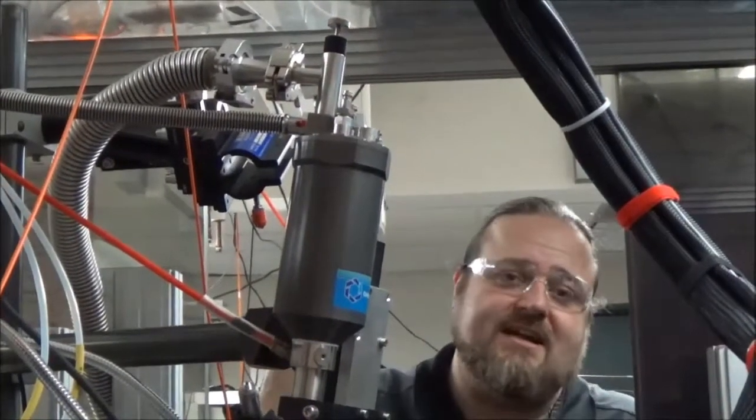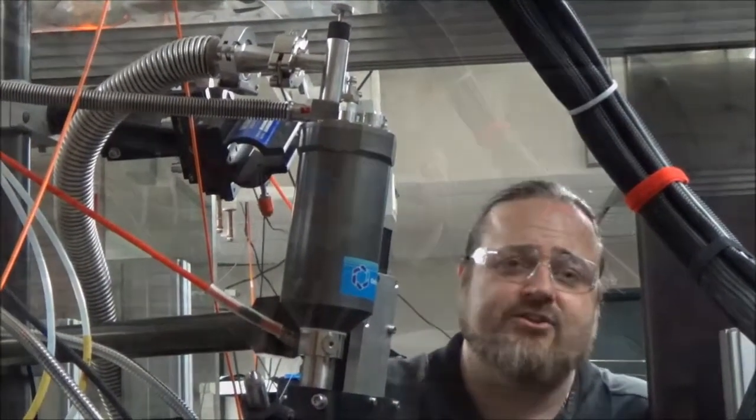So next up, I'm going to hit stop on the vacuum pump and we're going to break vacuum and be back in just a second.